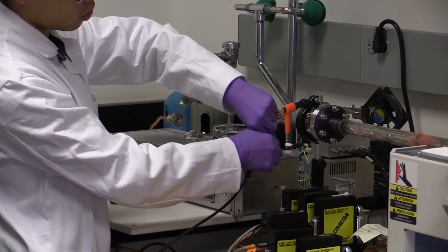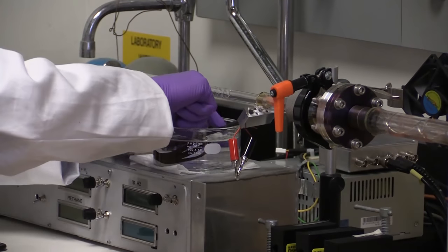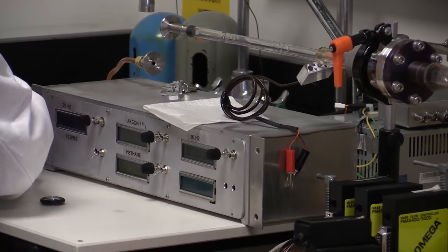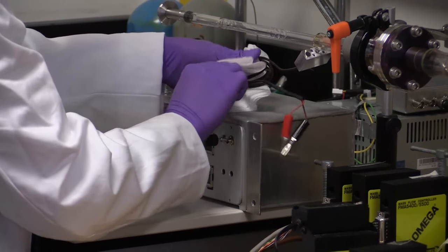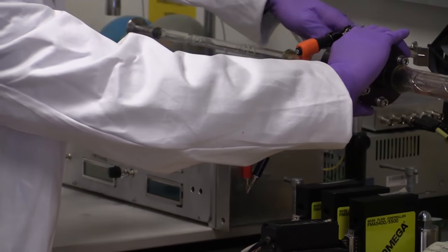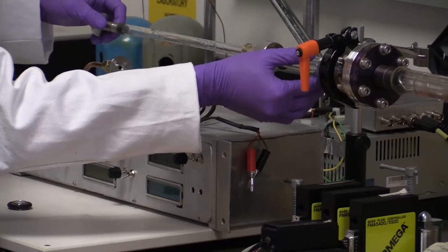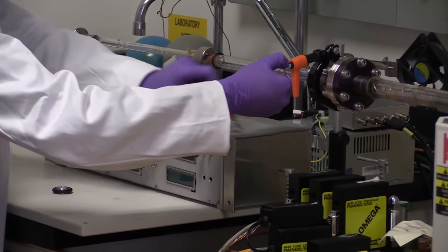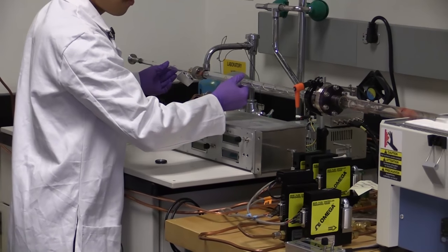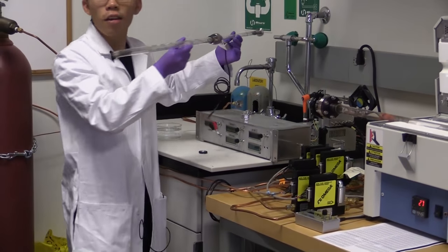Take this out of the water. Dry it off a little. We'll undo the quick connect. And carefully pull out the crucible tube. Good. Still right side up.